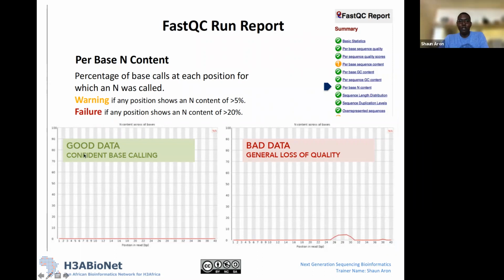So essentially in good data, this is percentage on the left-hand side, on the y-axis, and on the x-axis we have, again, each of the positions, from 1 to 40. And what is plotted in red here is the percentage of Ns. So at each position, it's looking for Ns. And basically, we want to see this as close to 0 as possible across all our reads. So we don't want to see any Ns.